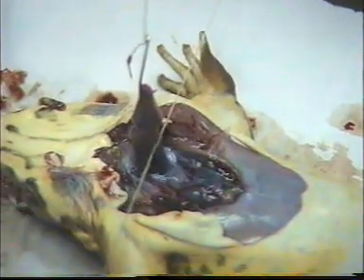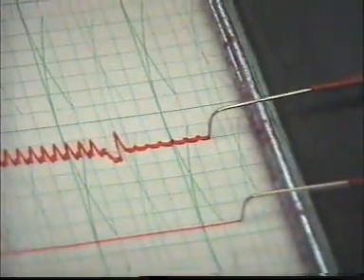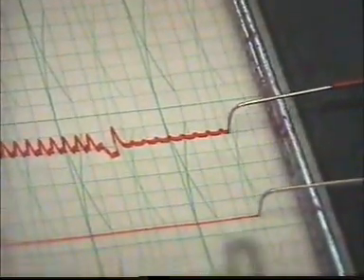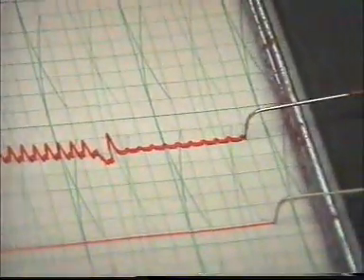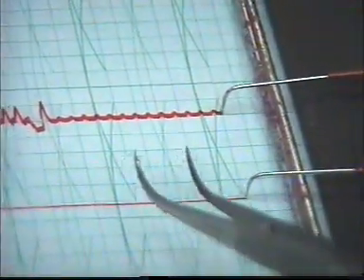I'm going to tie the first Stannius ligature, and see the effect of the ligature on the heartbeat. Okay, then tie. You see now, after the first ligature, the beating of the heart changed, because this is only the beating of the sinus venosus, because we blocked the transmission.